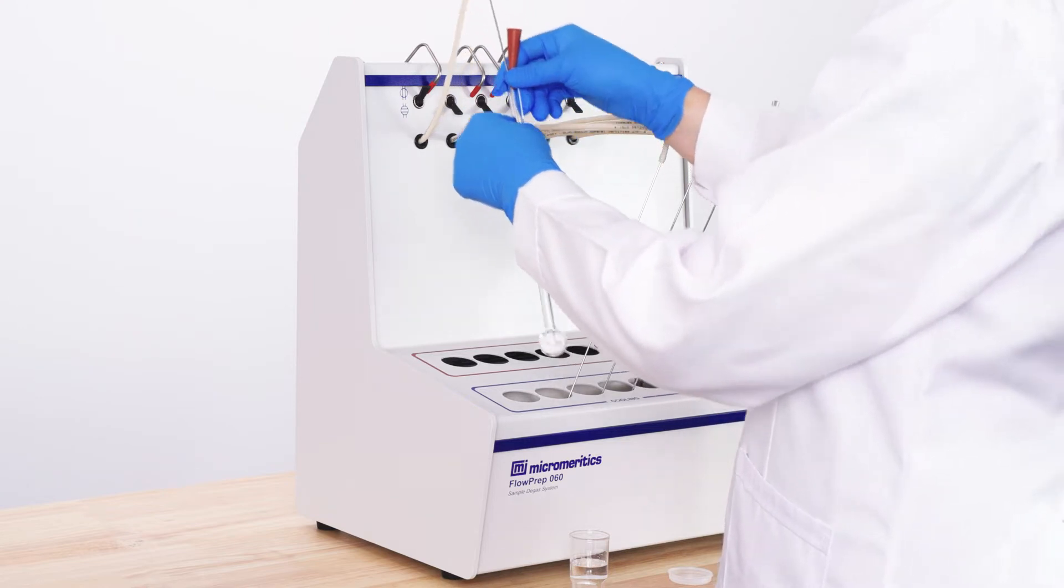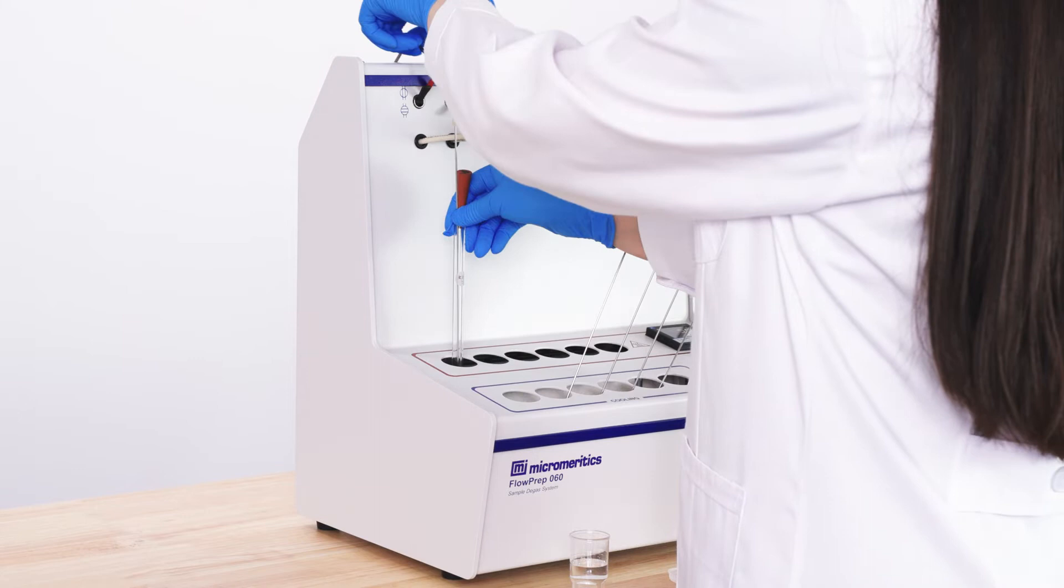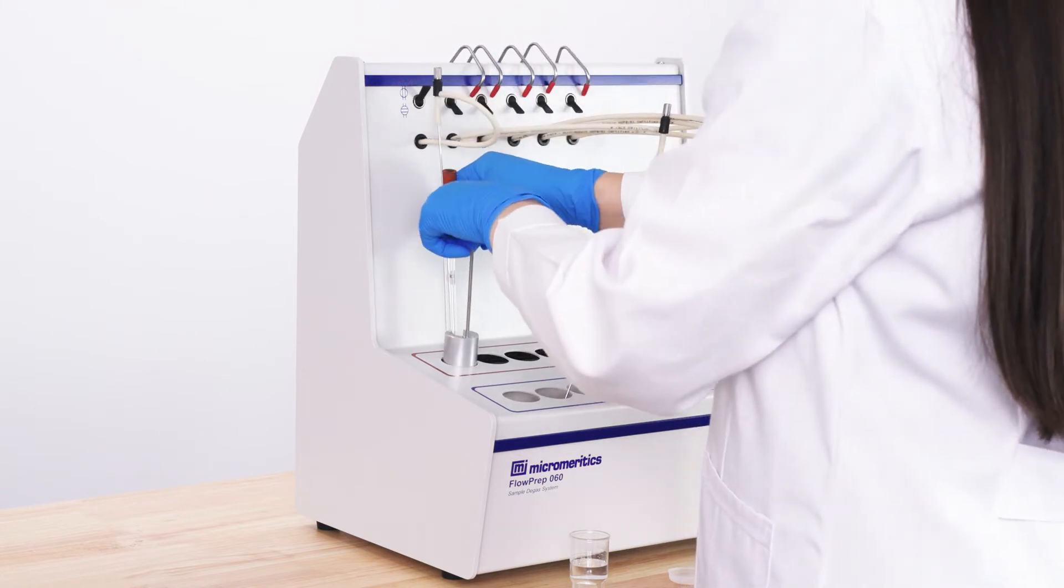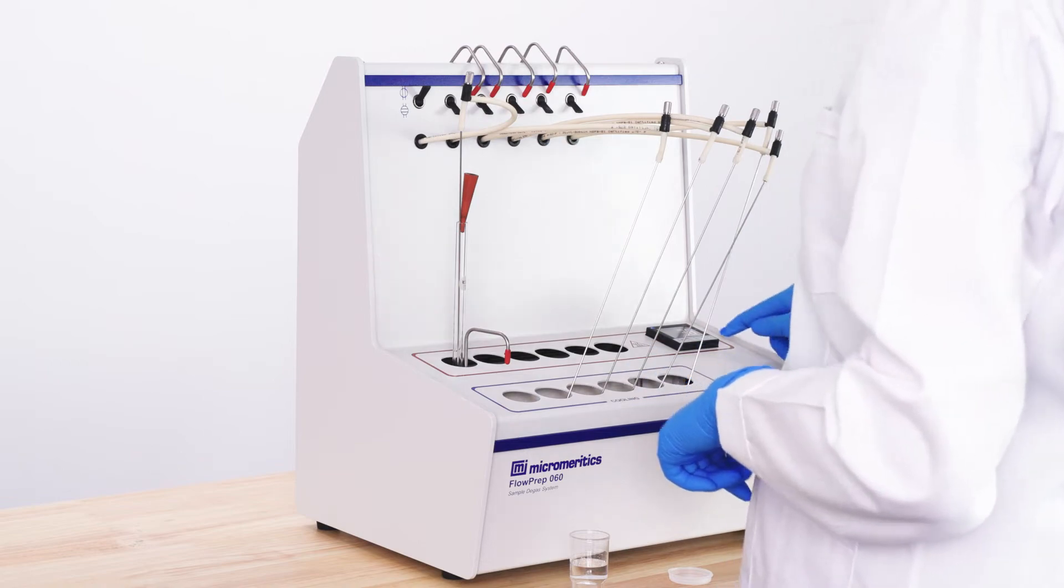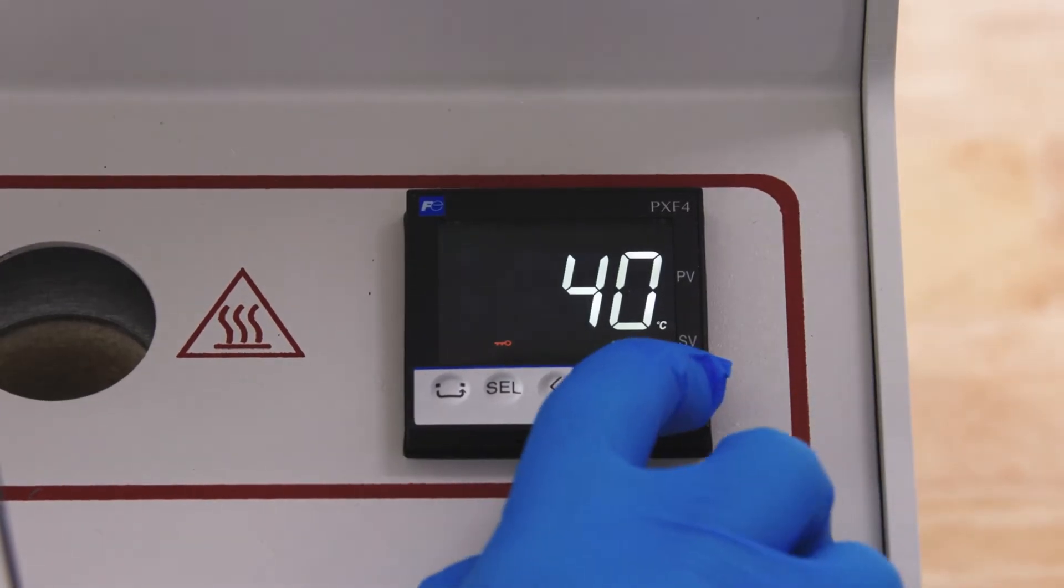Put the sample tube in the heating station and change the temperature with the arrow buttons.